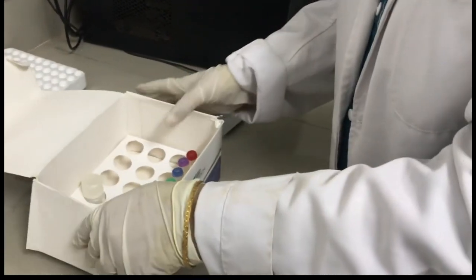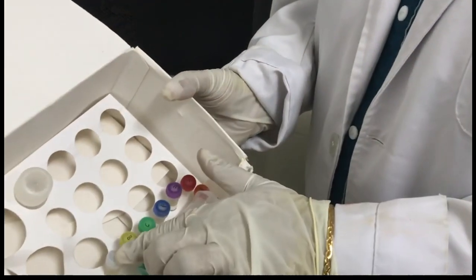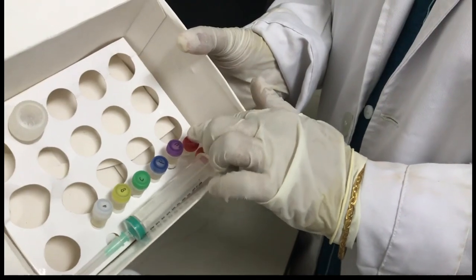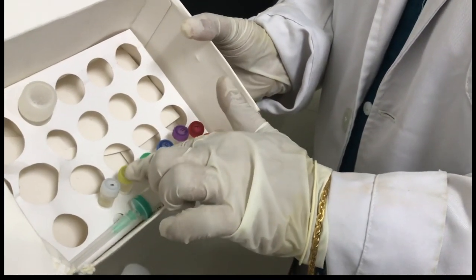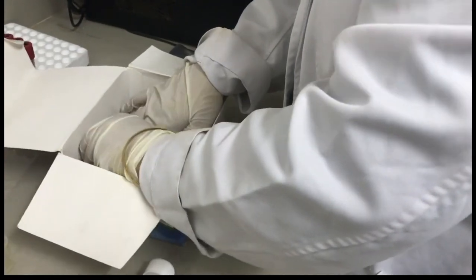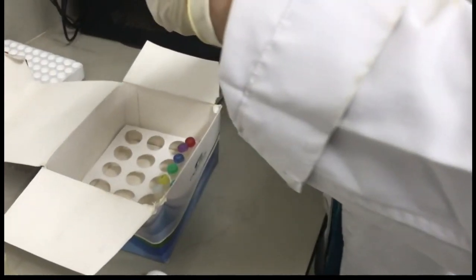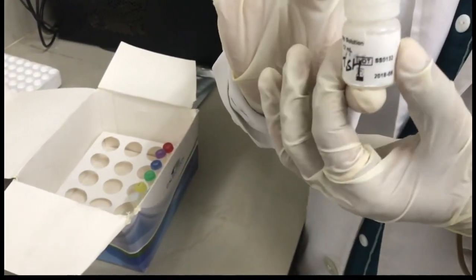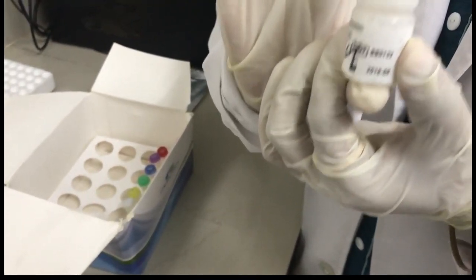Here are all the controls, which you can see here. These are different controls which we have marked as A, B, C, D, E. One thing which has remained here is this is the stop solution, which we are going to use at the end to stop the reaction.